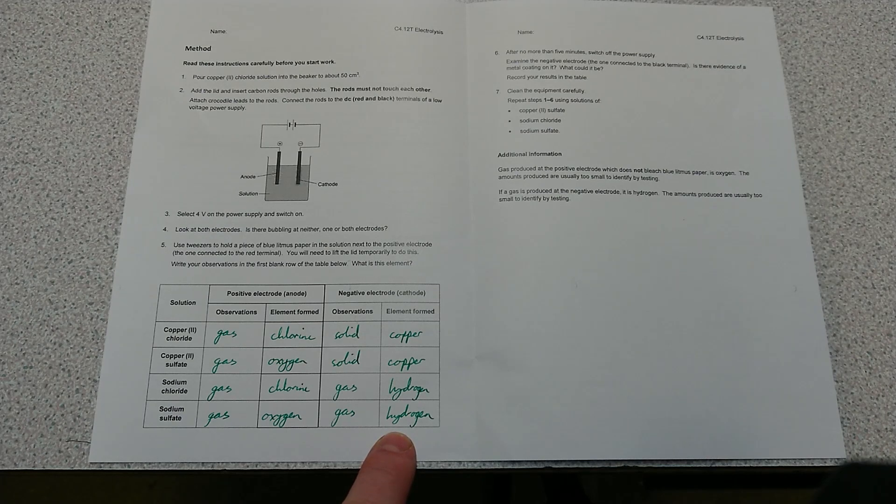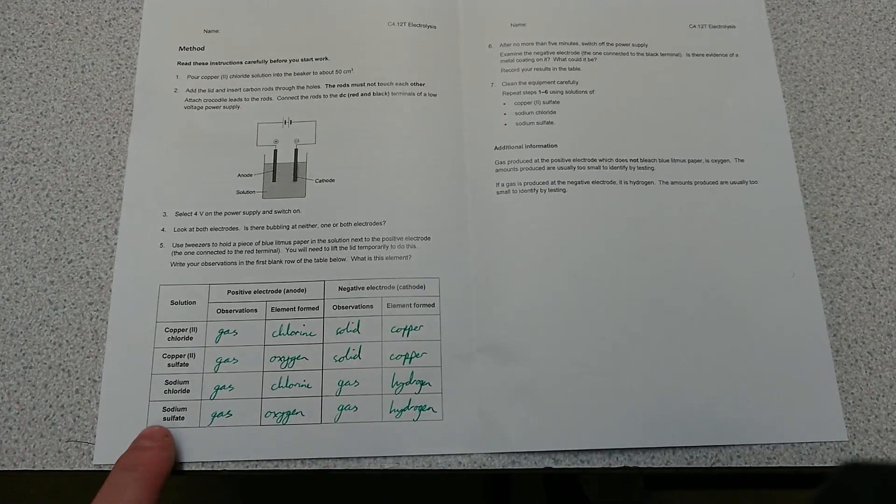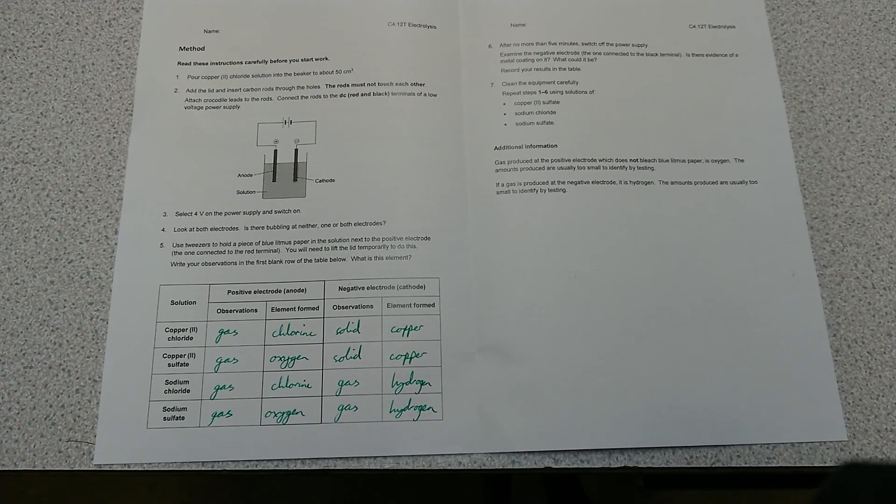Now the hydrogen has come from the water because these were aqueous solutions. The reason that we get the hydrogen, not the sodium, is because sodium is incredibly reactive and stays in the solution and the hydrogen gas is given off.